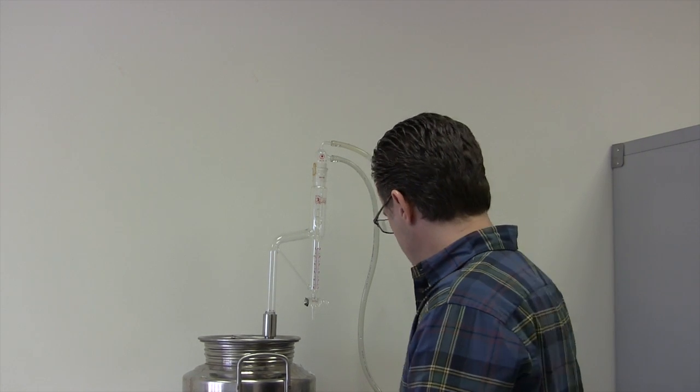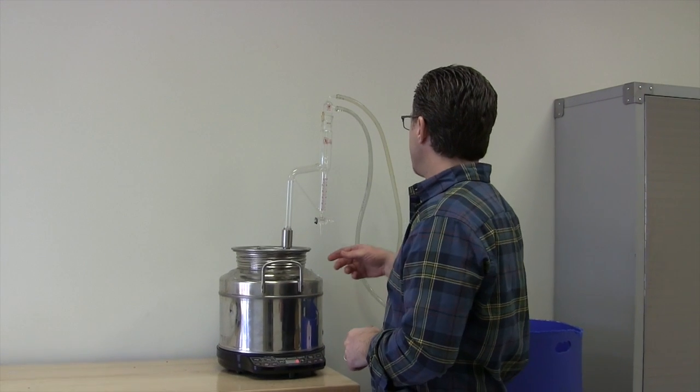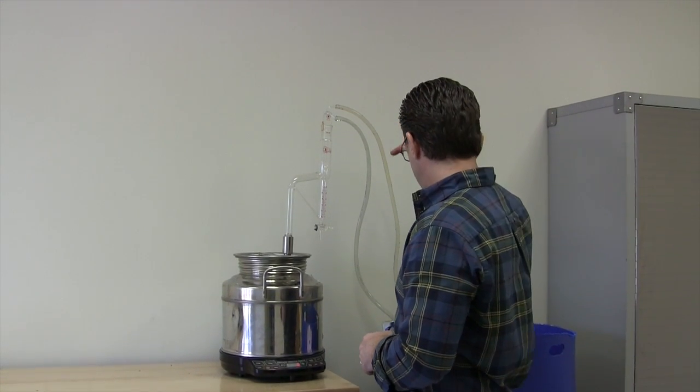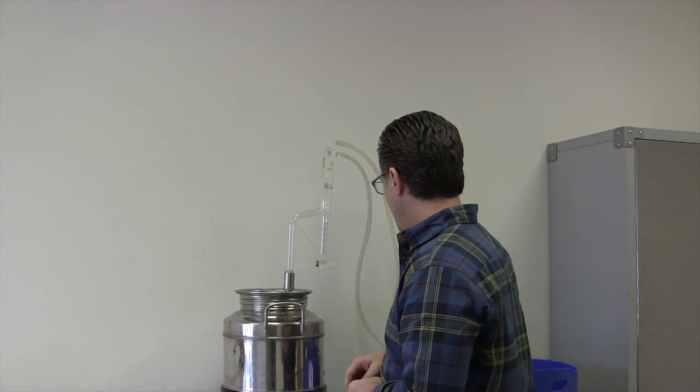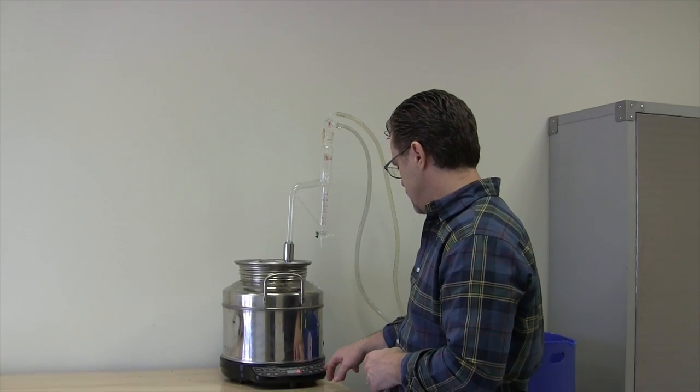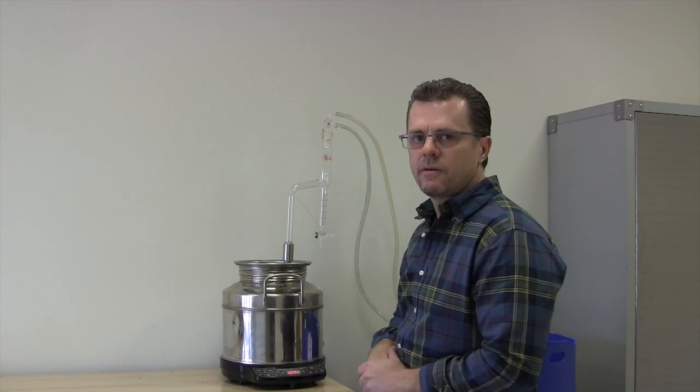I'm going to turn on the heat and the pump. As you can see, the water began pumping, and it's circulating through the condenser coming out here. And all we have to do is start the inductive heater.